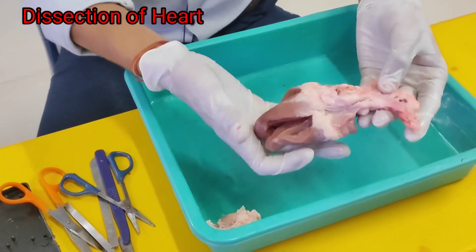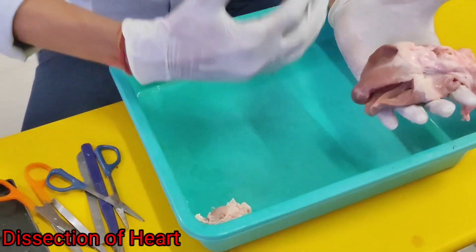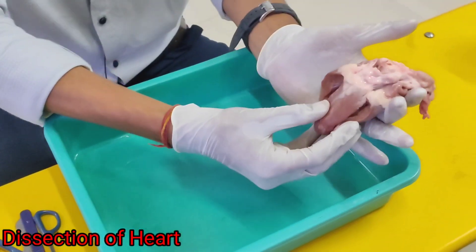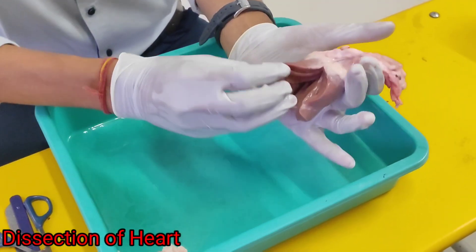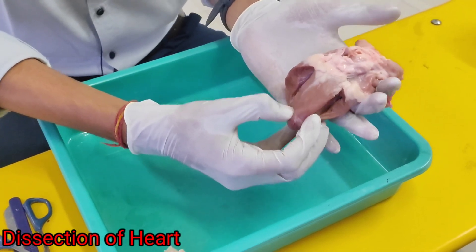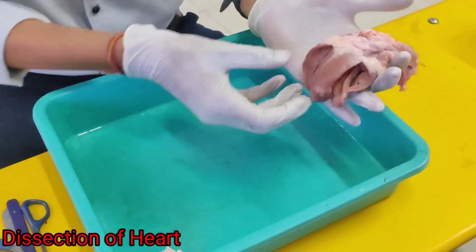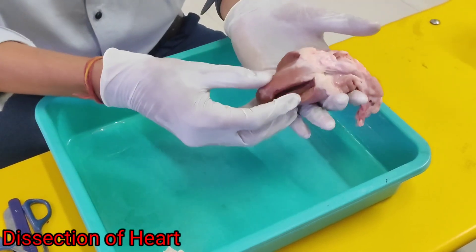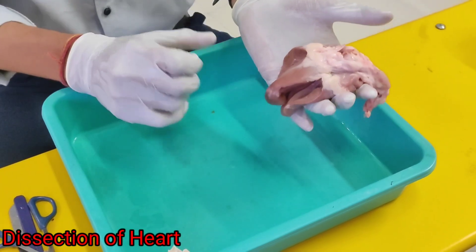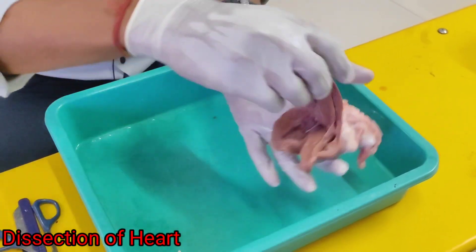See, this is the structure of the heart. How will you differentiate which side is left and which side is right? If you look here, this part and this part are very thick. As we all know, the left side of the heart is very thick, and the right side is very thin, because the left ventricle is responsible for transporting blood all over the body. This is the open heart structure — see how thick it is.